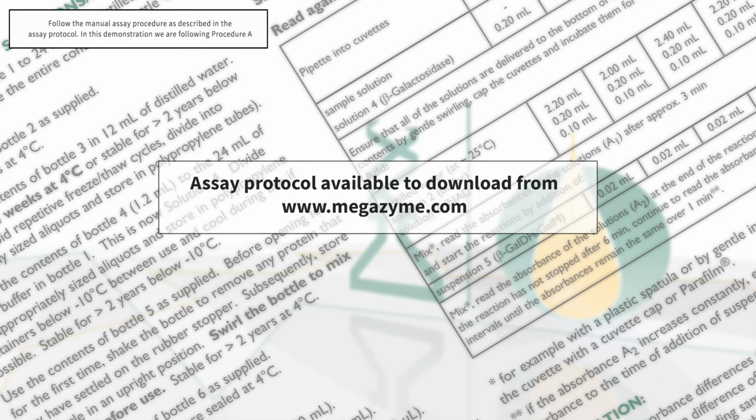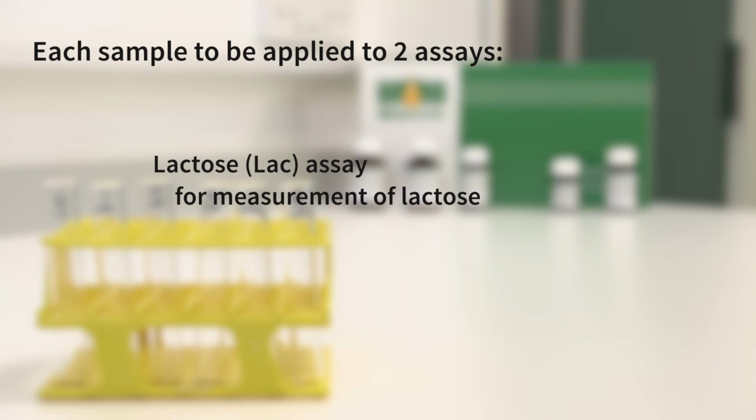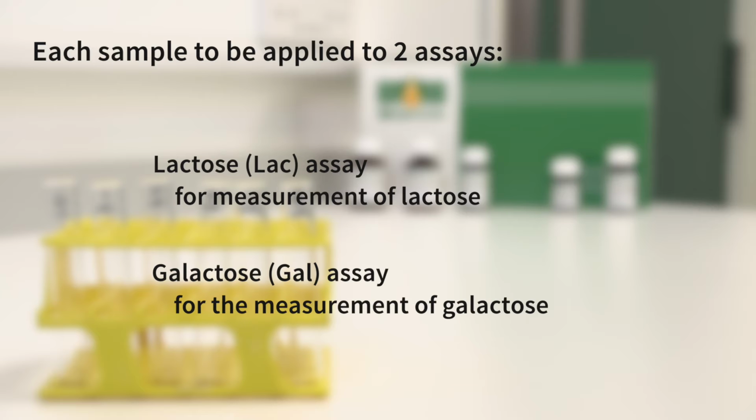Follow the manual assay procedure as described in the assay protocol. In this demonstration, we are following Procedure A, the standard assay procedure. This assay requires each sample to be applied to two assays, a lactose (LAC) assay for measurement of lactose and a galactose (GAL) assay for the measurement of galactose.